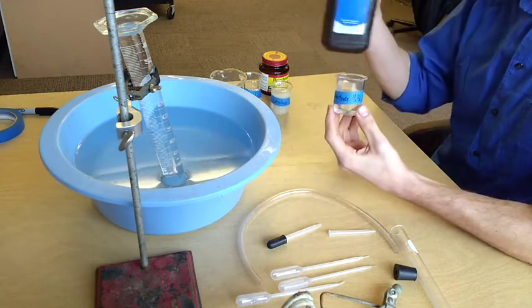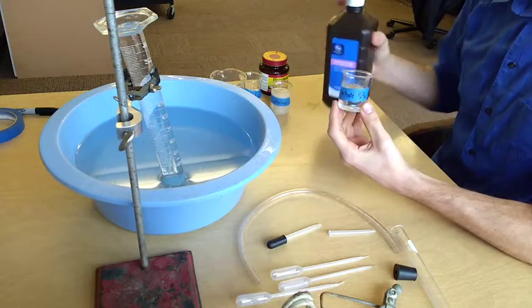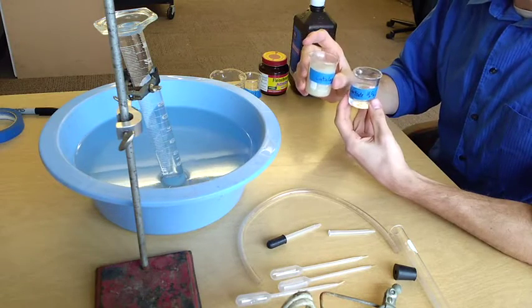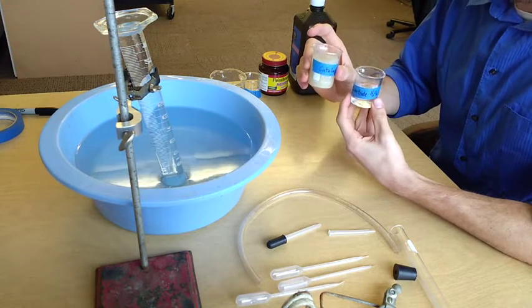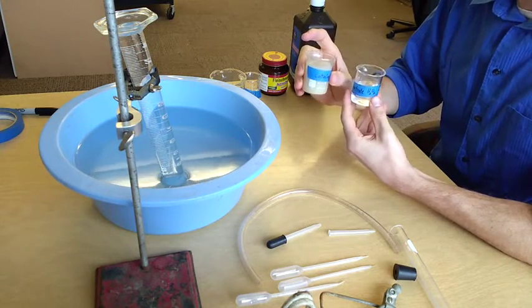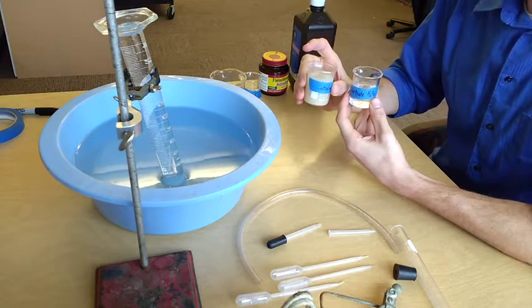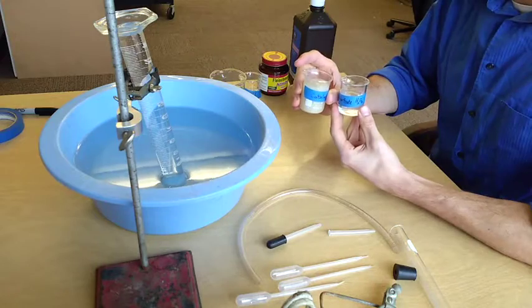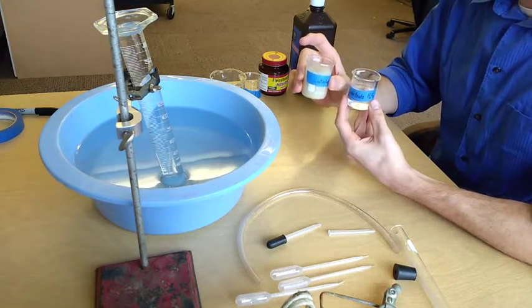Which you may have gotten in a bottle like this. Hydrogen peroxide does not break down very quickly unless it's mixed with this enzyme, catalase. And if it does, it makes oxygen gas. And the production of that gas is what we're going to measure to measure how fast the reaction is occurring.